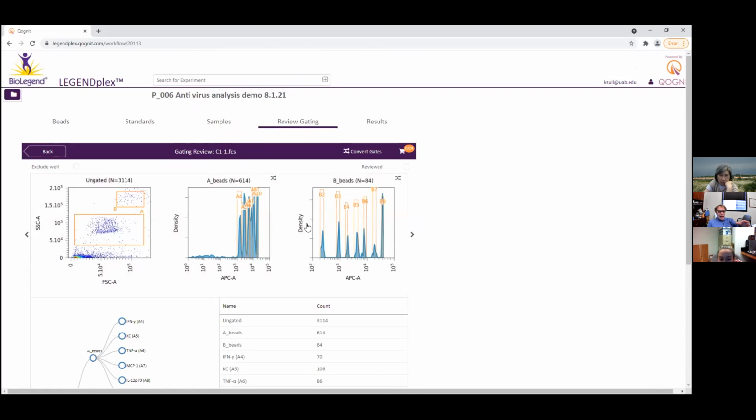So why can you do it now when you couldn't do it before? I just didn't know where the button was. There was a button at the bottom saying stamp gating, and I didn't know what that meant, so I didn't do it. It's not in the instructions to do that. I was just following the instructions for the software on their website because I didn't know how to use any of it. All right, I understand.